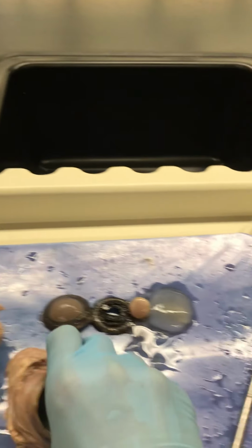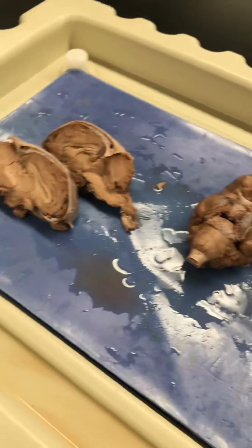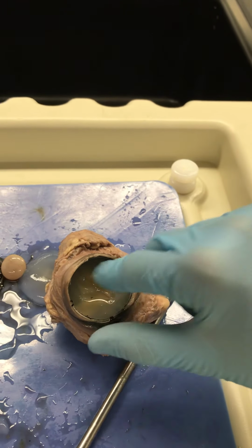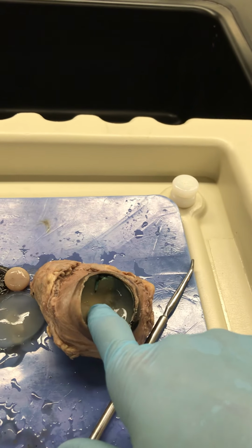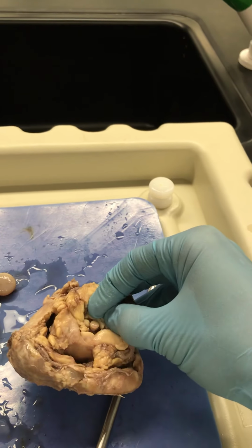So this is the retina. The retina is a tan structure, because remember how I said that the eye is just a very elaborate nervous organ, just like the brain is. And so this is the neural tissue in the eye. So this is where the nerves come in and connect. And do you see where they're cinching together? That's going to be where that optic nerve starts. So that, oh God, all that fat. There's the optic nerve, okay?